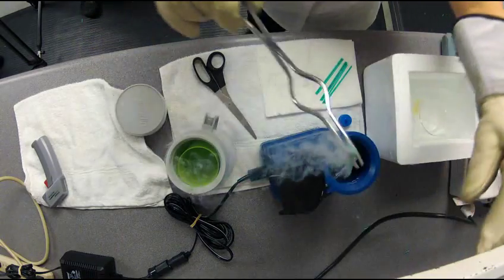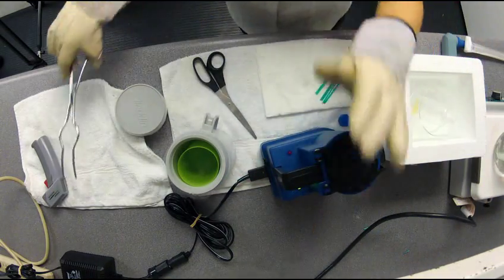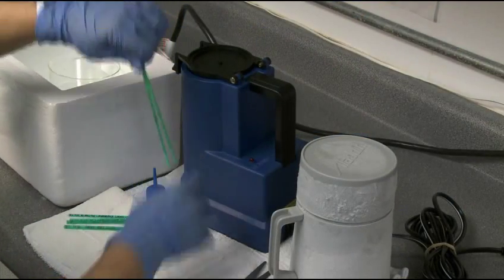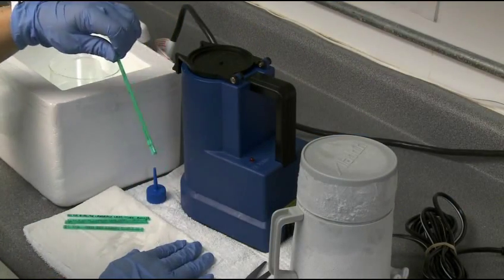This will create a dose of four billion total sperm cells which should produce a breeding dose of at least two billion motile sperm cells based upon acceptable post thaw recovery rates.